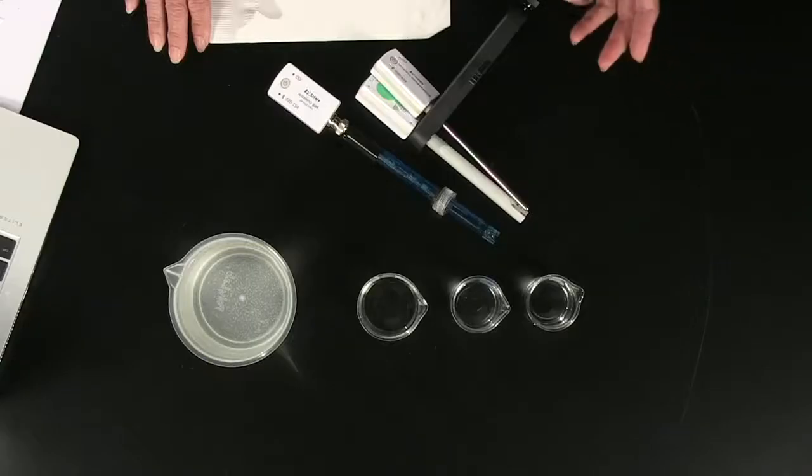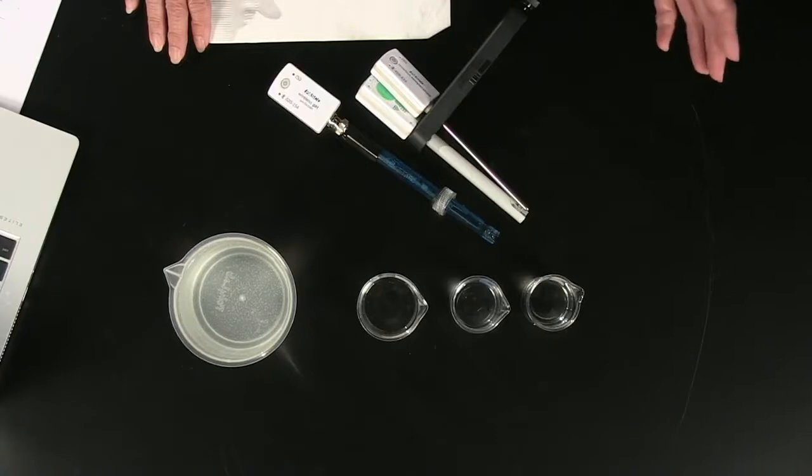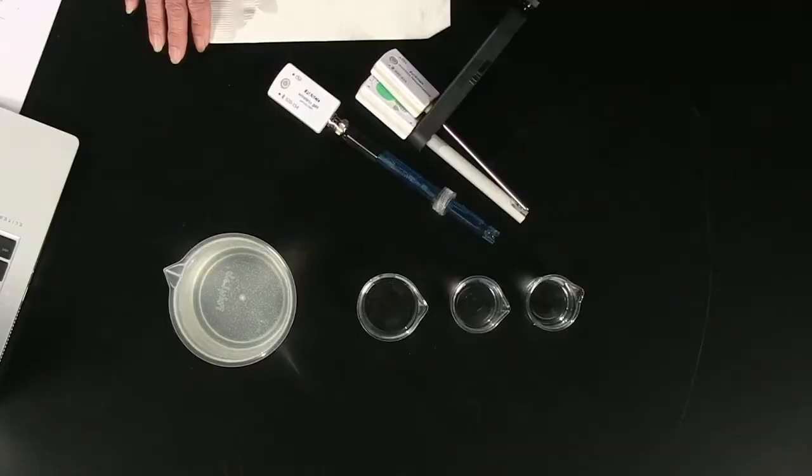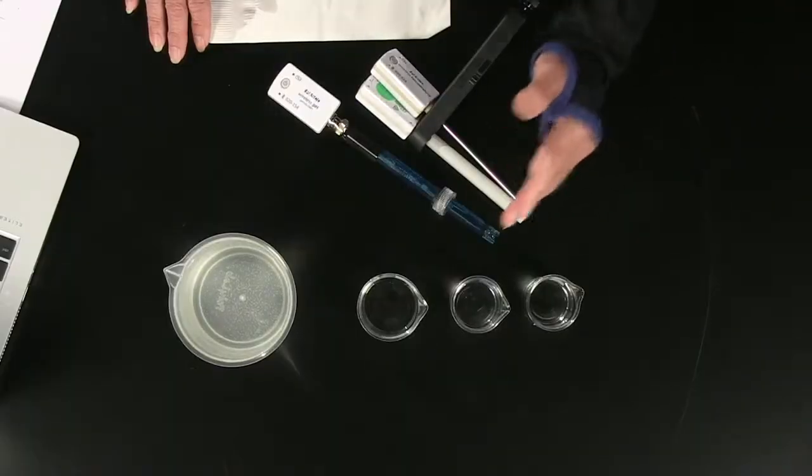And so for that, we are actually going to be using, for this section of the lab, a group of sensors. We're going to be using the wireless pH sensor, the wireless conductivity sensor, and a wireless temperature sensor. Your teacher may give you any one of a variety of different options of the labs we tested to run. However, for this particular lab, I am going to be picking lab G, in which we took an acid and mixed it with a base.